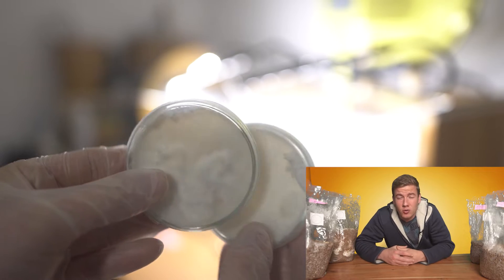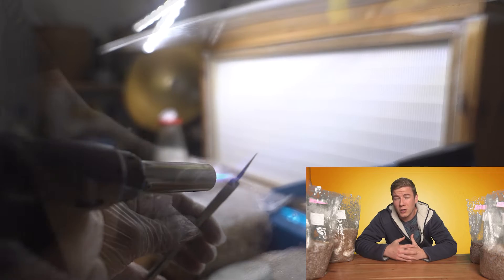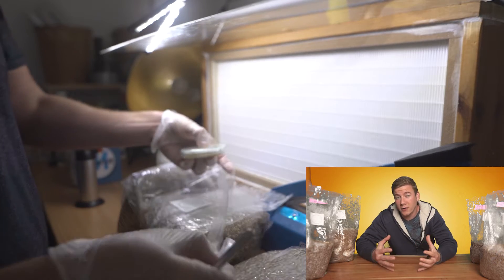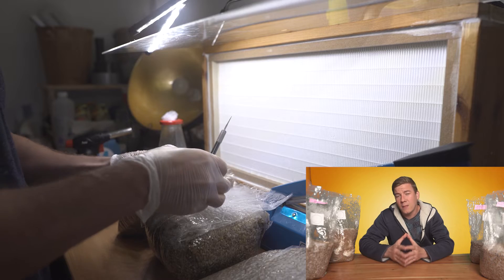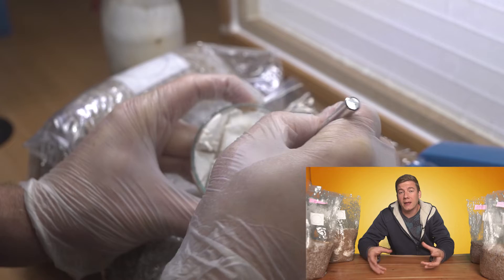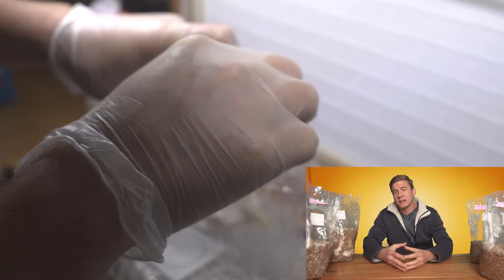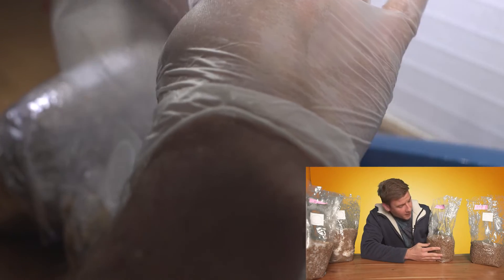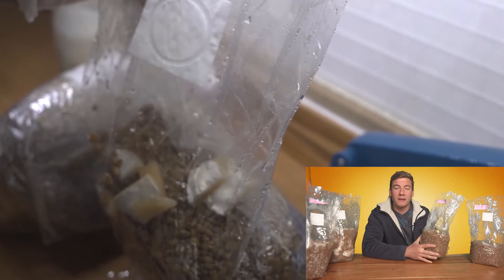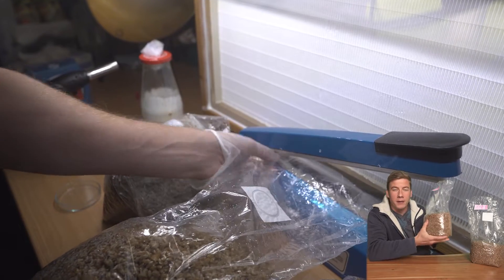Okay, let's start with the king oyster mushroom. To add the mycelium to the grain I'm using a scalpel which is sterilized with a blowtorch — just put it into the flame until it's glowing hot red. Then we start by cutting the mycelium on the agar into slices and putting it into the bag, while keeping the bag oriented toward the sterile air coming from the flow hood. I've seen other people use just three or four slices of petri dish to inoculate grain spawn.